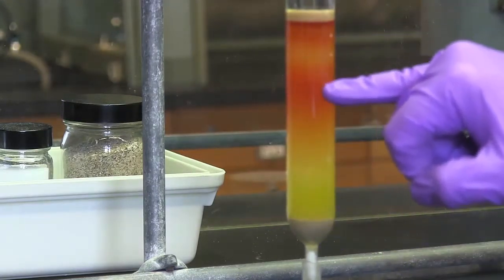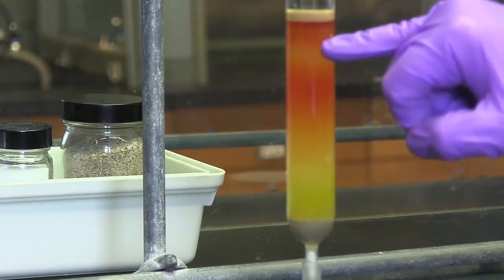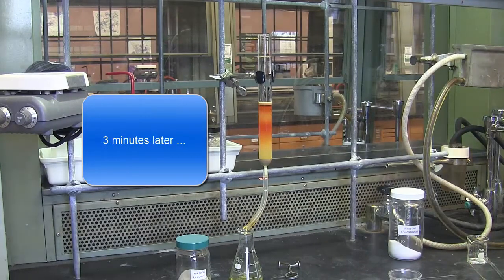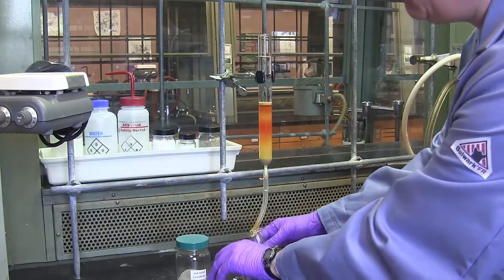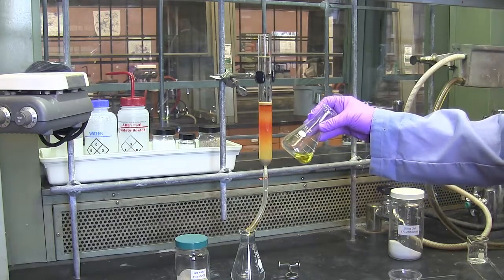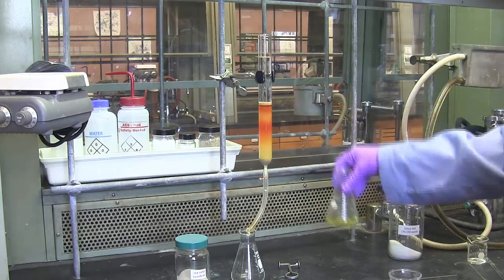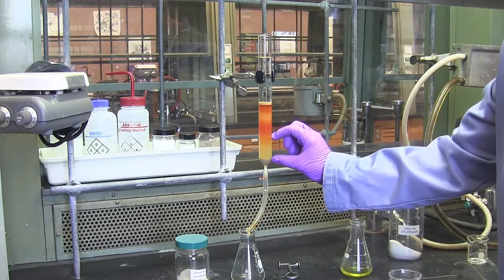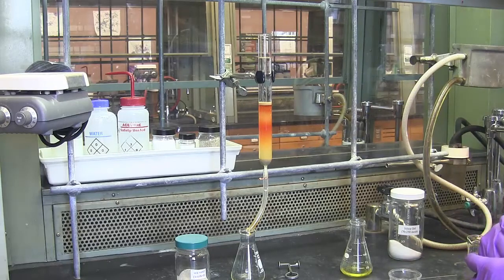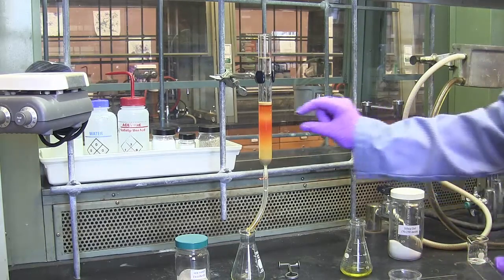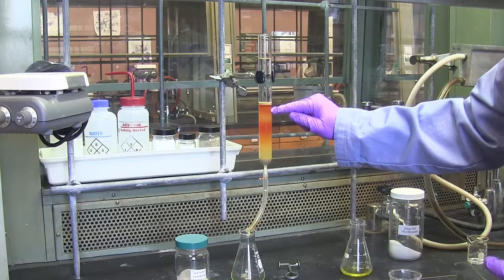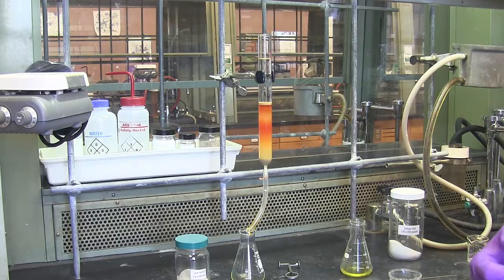There's definitely a darker orange-red band that's coming off. And then if I switch to more polar solvents, I can get some of these more polar components to elute from the column. The yellow band has almost completely eluted, so I would switch to collection flasks. You can see we definitely have something in this first fraction, at least one component of a paprika extract. And then if I were actually doing the paprika experiment, I would probably collect this material in a waste fraction. I would go ahead and switch to a more polar solvent. So I would probably pull the solvent eluent that's on top now off the top of the column and add a more polar solvent. I would collect this as my second band. And then I would probably collect this as my third band. It's a very faint band, not very concentrated. But that's how I would proceed if I were going to continue with this column.